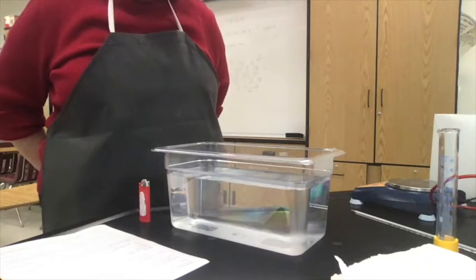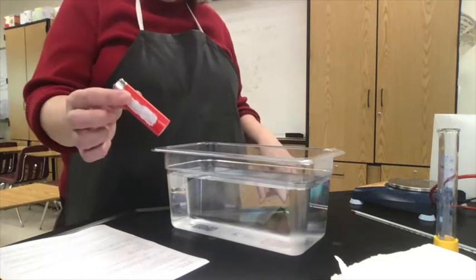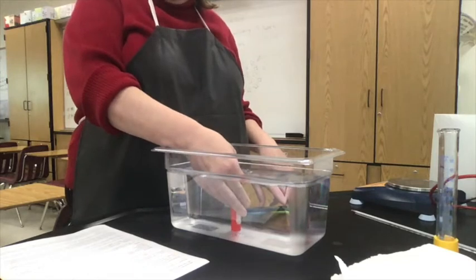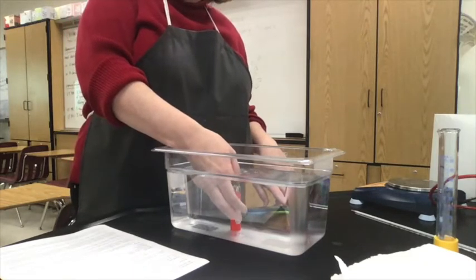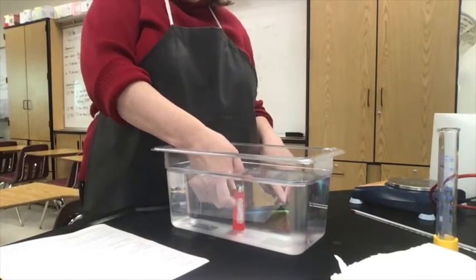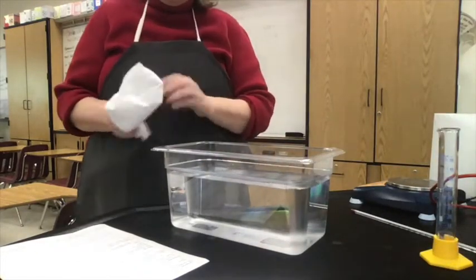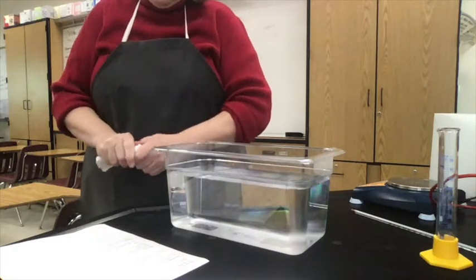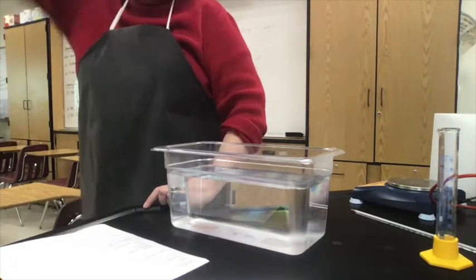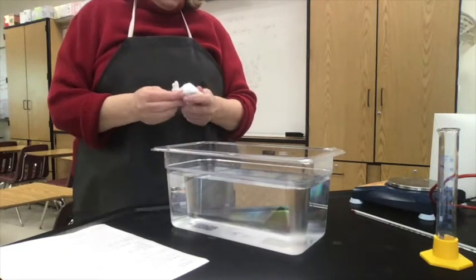I would recommend that you have the procedure handy so you can follow along. Starting with step number one: take this butane lighter and submerge it in a basin of room temperature water and press the lever. You can see it's bubbling up. This step just has to be done once to start the lab. A very important step once I take the lighter from the water is I have to shake the excess water out of it to dry it off very well, because I don't want extra mass in my lighter.